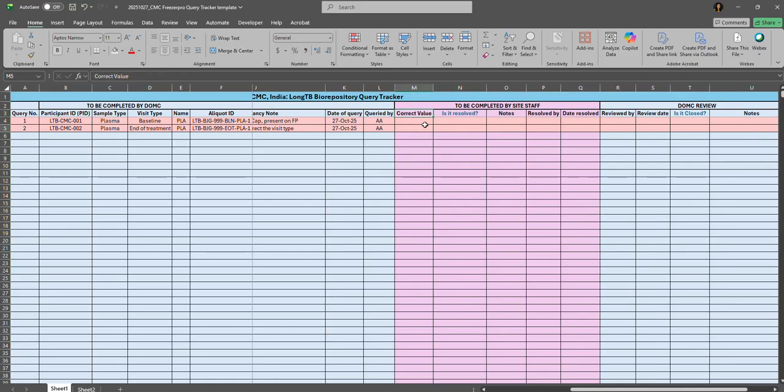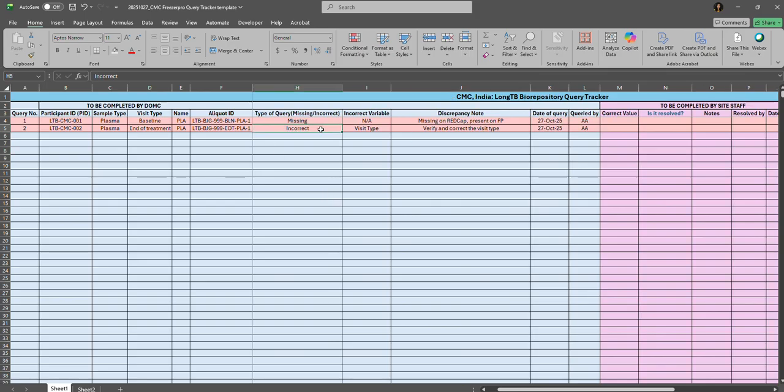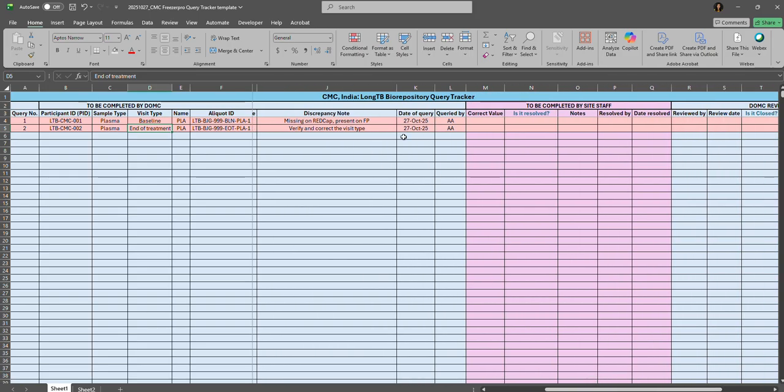They must enter a corrected value for an incorrect type of query and add notes in the notes column if there are any. For example, here there is one incorrect type of query where it says verify and correct the visit type. Suppose the EOT visit type is entered as end of treatment visit type twice, and there's supposed to be only one plasma aliquot, so we think the visit type would be incorrect. The sites will then go back to their sample repository reports or their freezers and correct the values accordingly on the FreezerPro or on their sample repository reports and enter the corrected value.